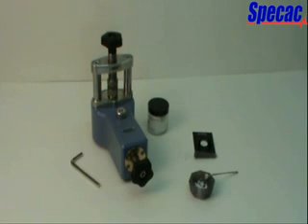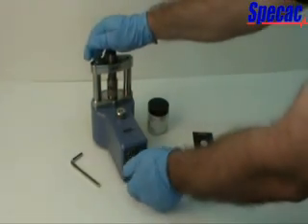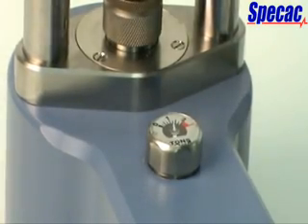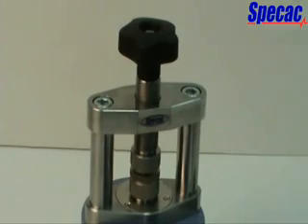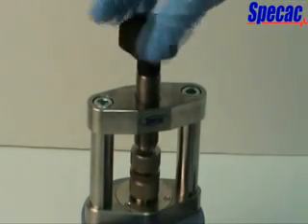The load is held for circa 10 seconds. Remove the pressure tonnage load from the pellet die assembly by full anti-clockwise rotation of the pressure screw knob assembly. Loosen the lead screw assembly by turning anti-clockwise and remove the pellet die assembly.